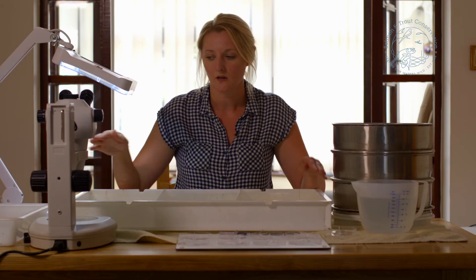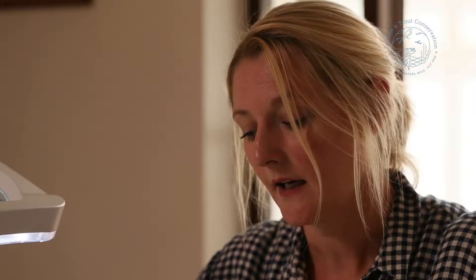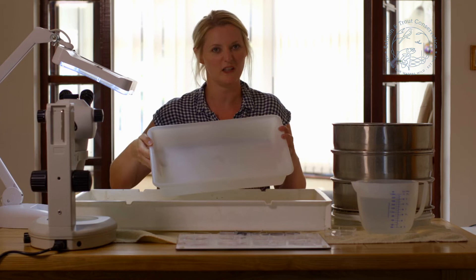Our sample goes into a tray. We just have a bakery tray from a baker's. We separate it into grids with the perspex. You might decide you're going to work in a smaller tray, and these are also really easily available.